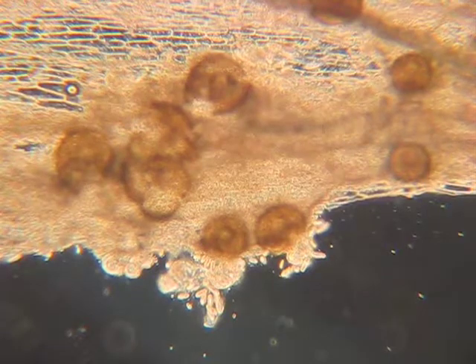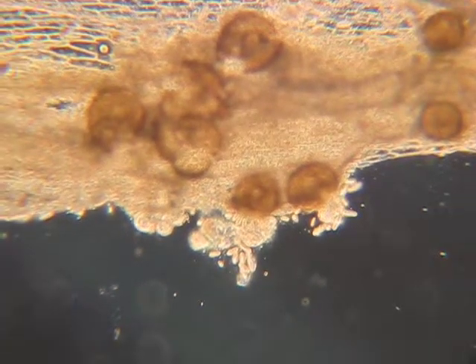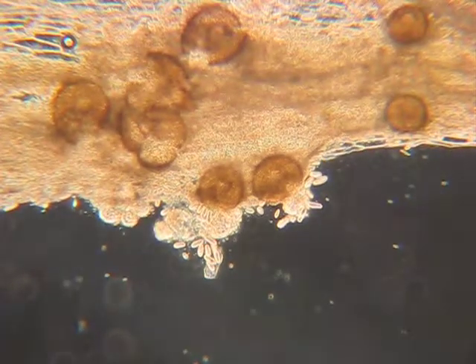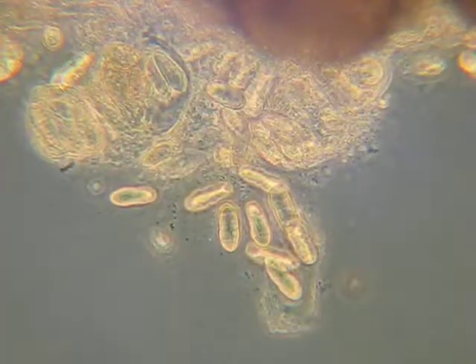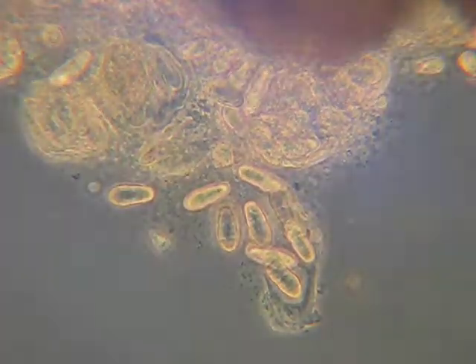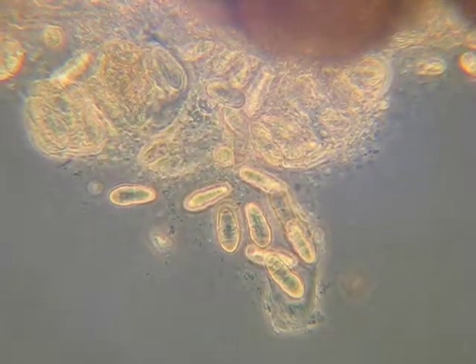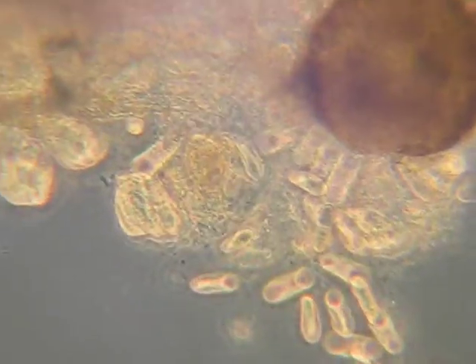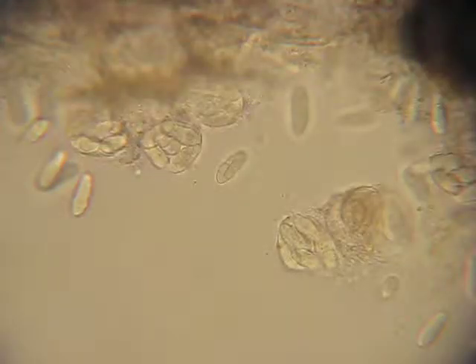Let's zoom in. So those are the spores, and there's some broken perithecia, and then we'll show you the details. Here we go. And now we're looking at the spores of the fungus, and they're in a sac. Let me see if I can find a clear one here. Okay, here's a few of the asci, or sacs, that the spores are borne in, and those are inside the perithecia, and they're expelled from the perithecia.